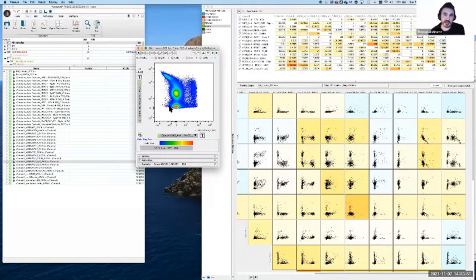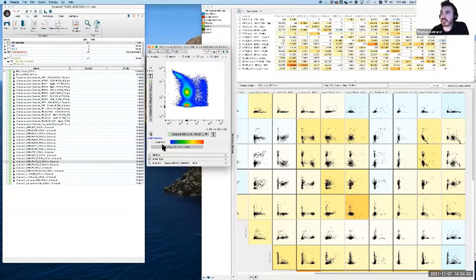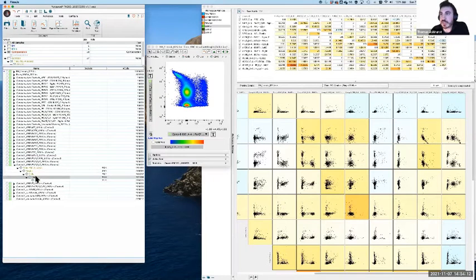That way, in an ongoing fashion, you don't need to be trying to fix these things all the time. Like we said, if we fix these fundamental practices early on, we tend to avoid most of these issues. So in this case, I've got PE-Cy7 versus PerCP-Cy5.5. So I want to get FMO controls for both of those colors, which I'll go and do. PE-Cy7.